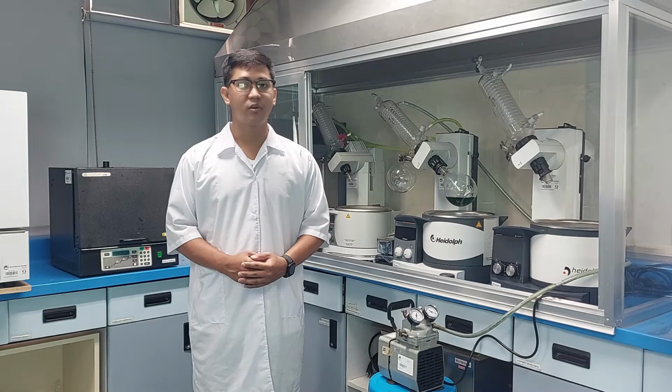It is mainly used for continuous distillation of volatile solvents under reduced pressure, removes solvents from reaction mixtures, and can accommodate volumes as large as 3 liters. It is used in biomedical, chemical, and medical fields.